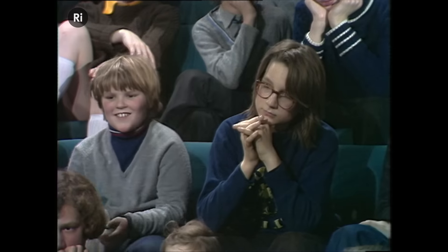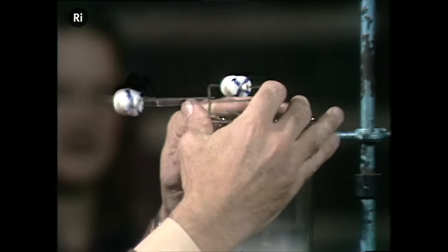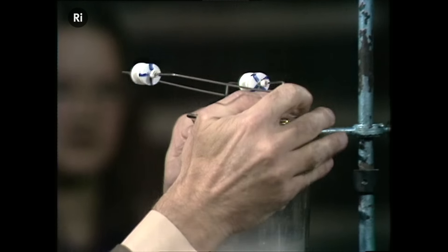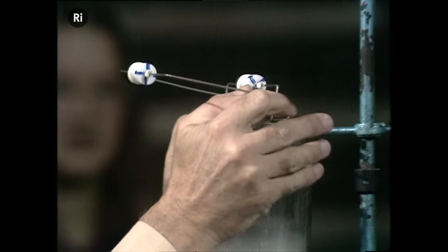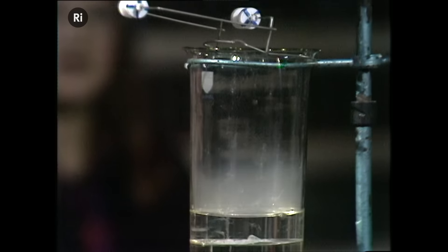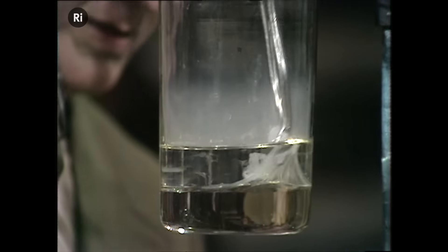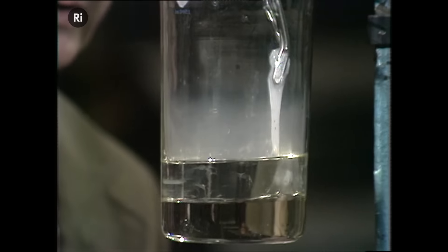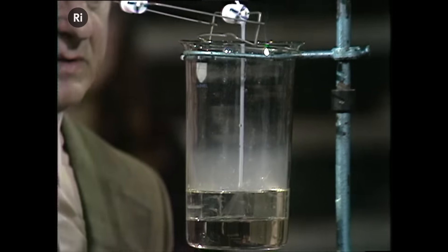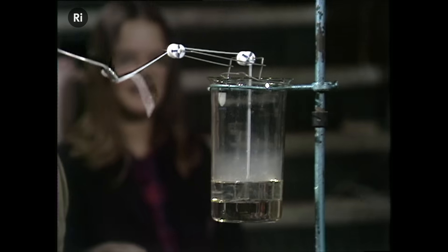We'll put a little spinneret on it, like this. Put this over the top of the beaker. So, do a bit more fishing. Pull the nylon out. There's a thread. Put it over the spinneret.